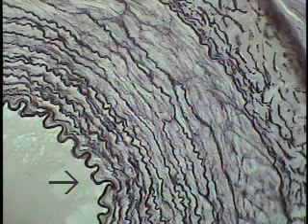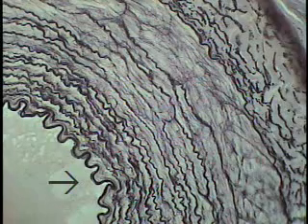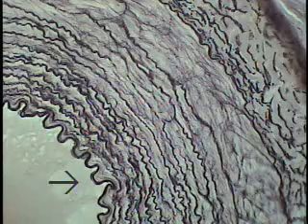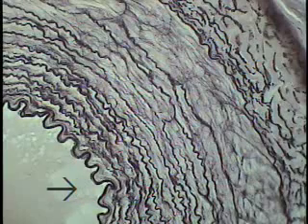This is a portion of a section through a muscular artery that's been stained specifically to demonstrate the elastin within this particular vessel. This is a muscular artery, but one that's been cut a little closer to the point of origin from one of the elastic vessels. Beginning at the lumen, the very same layers are demonstrated, of course.